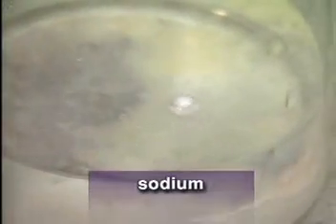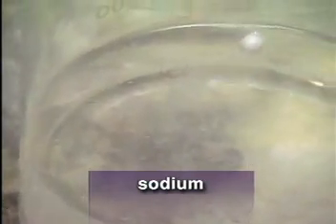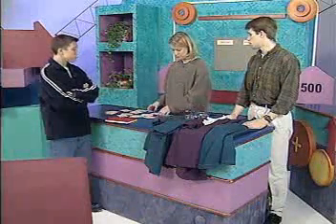But sodium had a pretty strong reaction, too. With the bubbles bringing it up to the surface. And they both reacted without adding extra heat. So you put potassium and sodium in the same group? Sure.